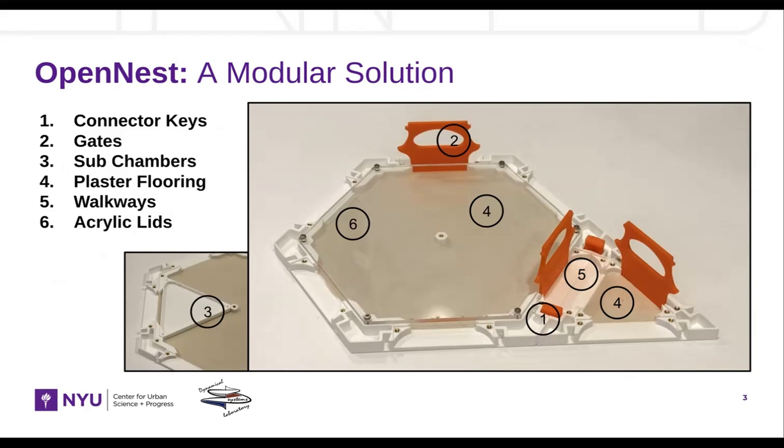Each of the nest components can be 3D printed, making assembly easy and reproducible. At the end of our presentation, we will share a link to a GitHub repo where you can download the STL files needed to print it yourself.